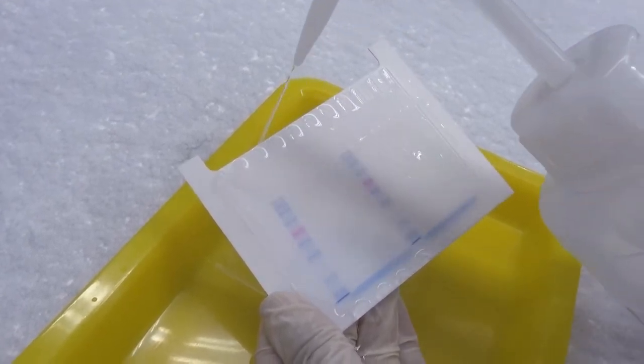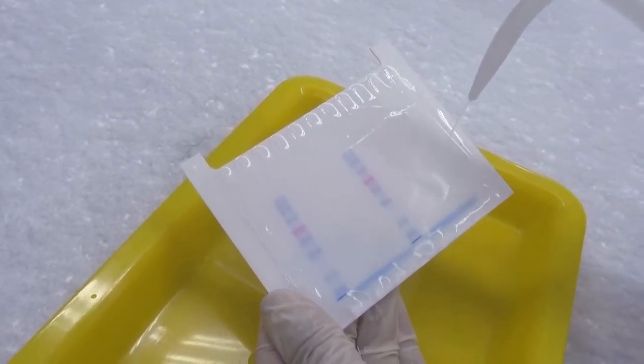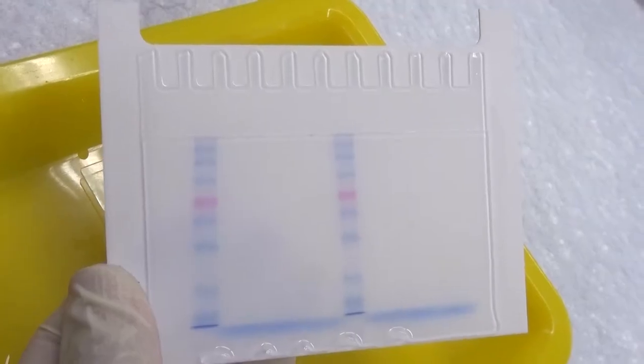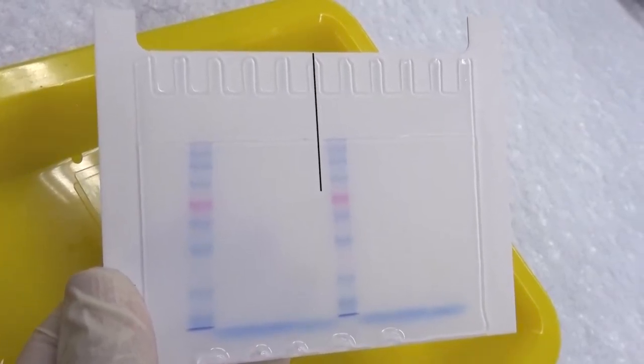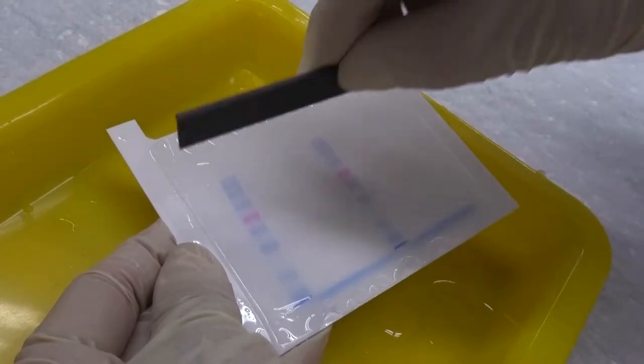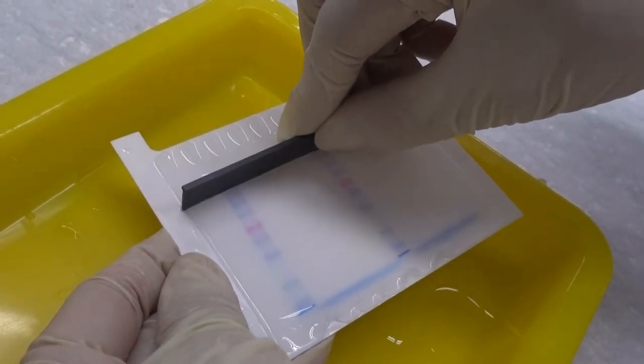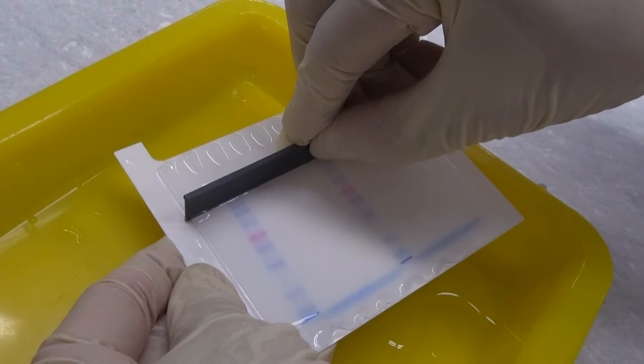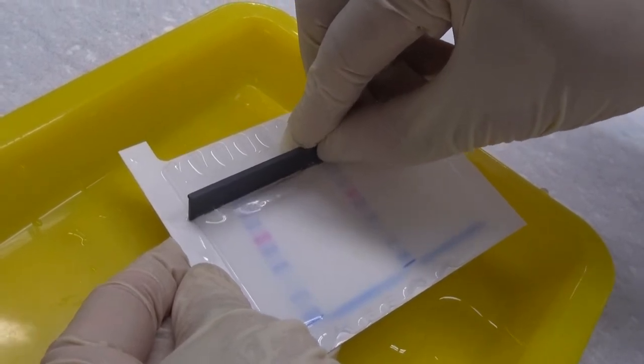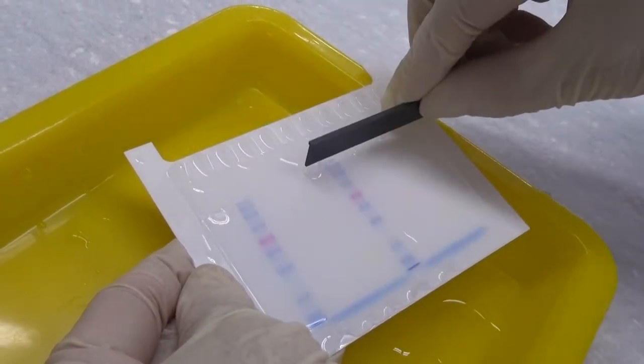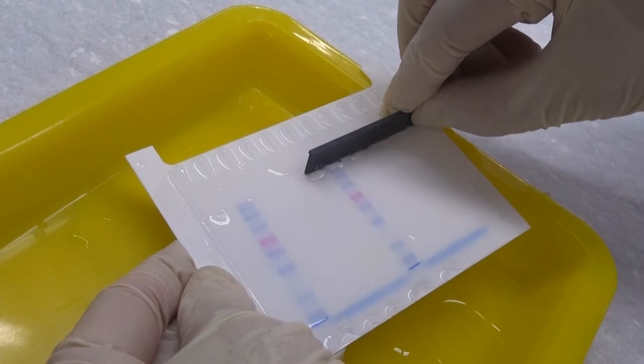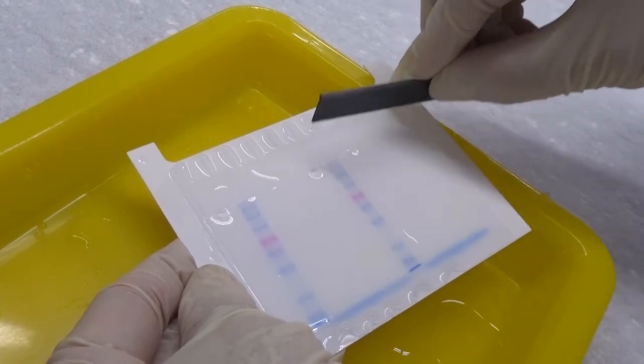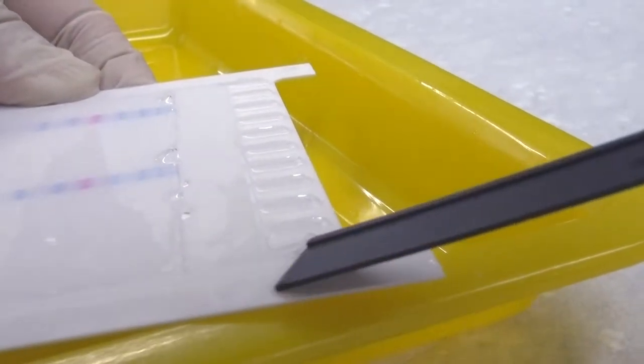Rinse it with distilled water to prevent it from sticking too tightly. Depending on the experiment, decide whether or not to cut the gel. Find the boundary line between the upper and lower gel and cut the gel along the line with a spacer or razor blade. Make sure to cut through the gel completely to avoid serrated edge resulting from tearing. Cut off the upper gel.